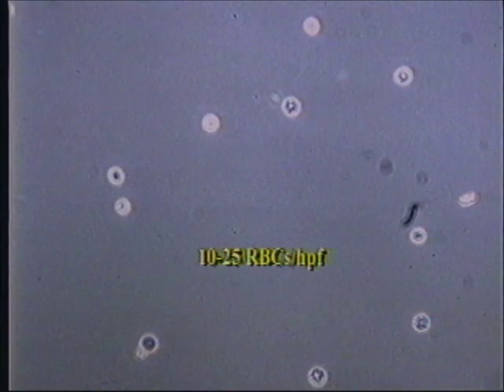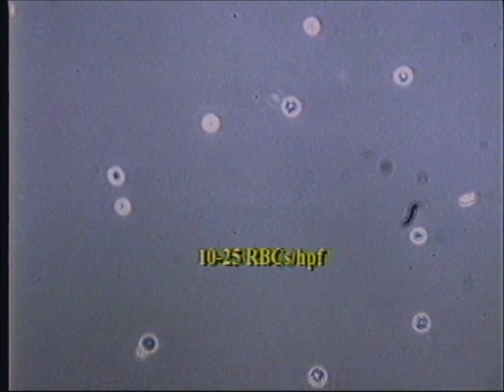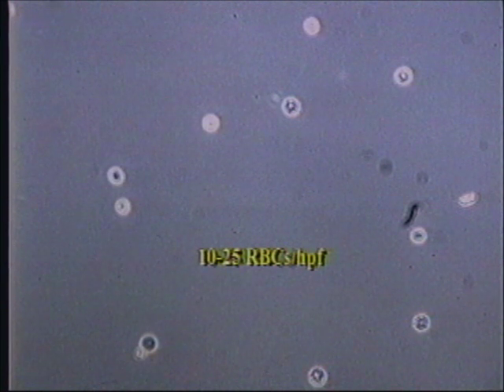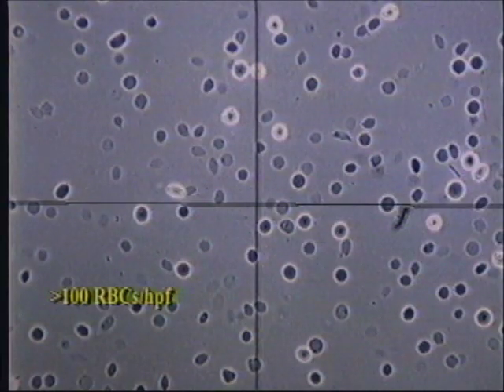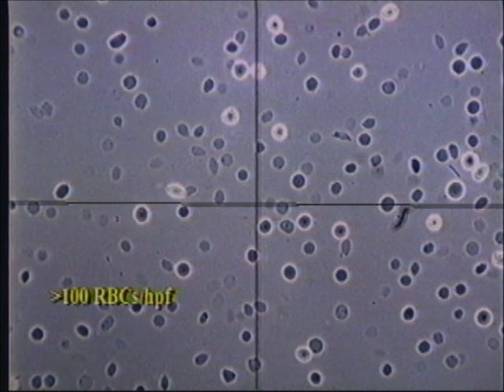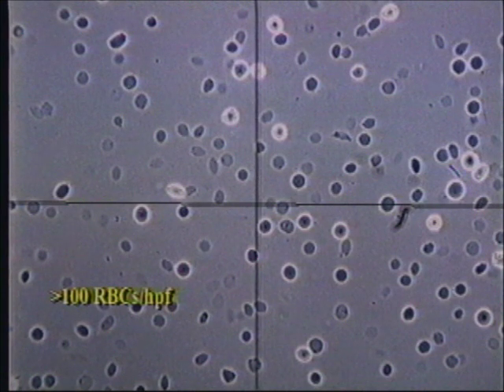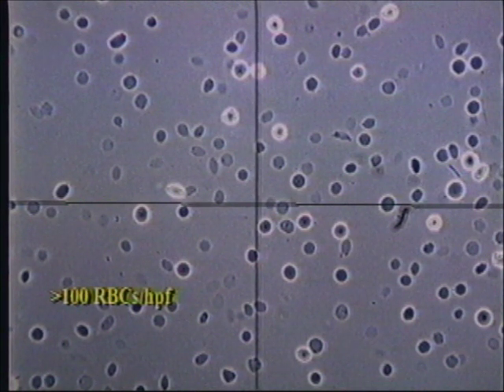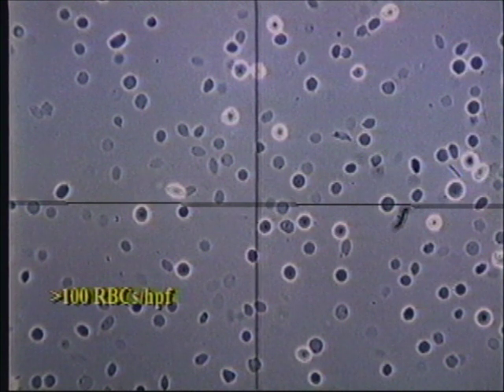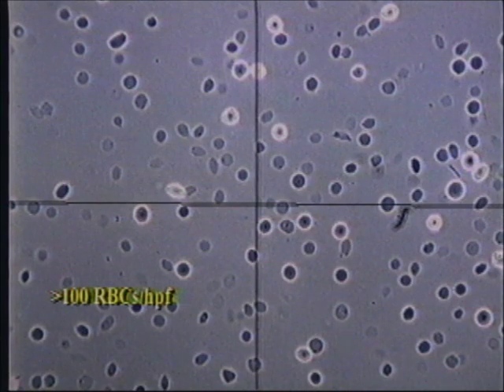Here's an example of how the grading system works. If this were one microscopic field and all 10 fields looked identical, you would report 10 to 25 red blood cells per high power field — there are definitely 12 red blood cells in this field with a couple of questionables. When you have numerous cells, you can see the advantage of using the crosshair ocular. Count the number of cells in a quarter of the field — in this example there are more than 25 red blood cells in a quarter of the field. Once you reach 25, you can stop counting and move on. The maximum range is greater than 100; it is not necessary to count beyond this. If all your fields looked like this one, you would report greater than 100 RBCs per high power field.